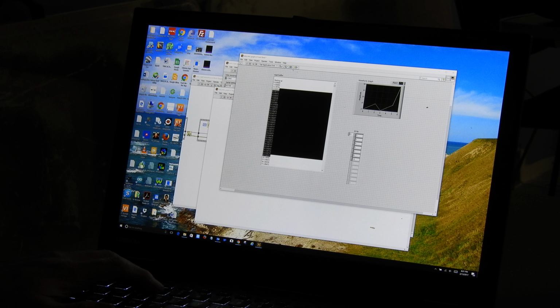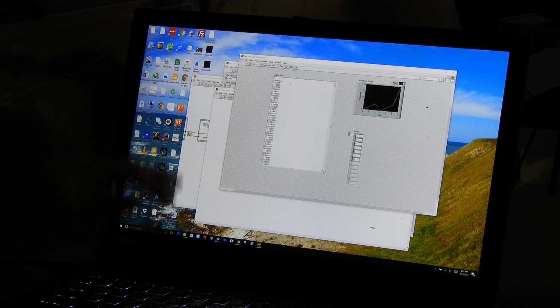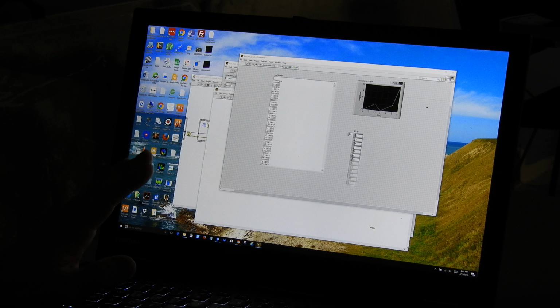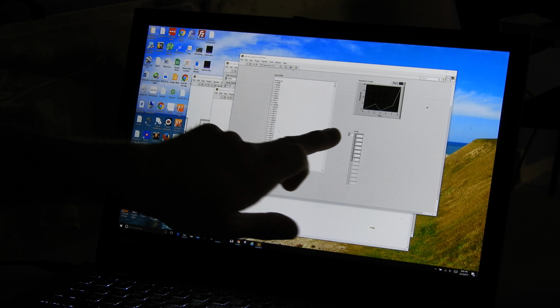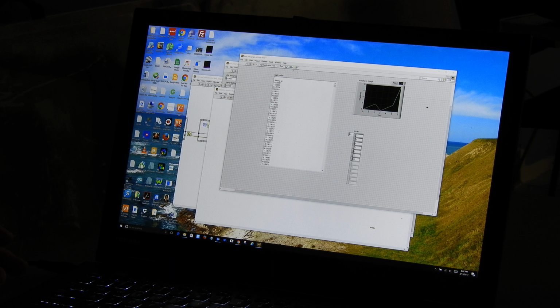Okay, so here's part 2 of our little video on how to graph the data coming from the CCD that we're using on the Raman Spectrometer. It's a 1D CCD, so when we do a read, we read out all the values, and all the potential wells. There's 4,000 up there. For some reason, we're getting 3,200 or so values here. But we're going to go ahead and write a piece of code that looks at the size of however much data is there and formats it nicely into these bins of this array, and then we're going to just have it plot to the graph.